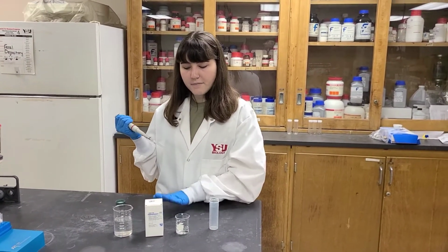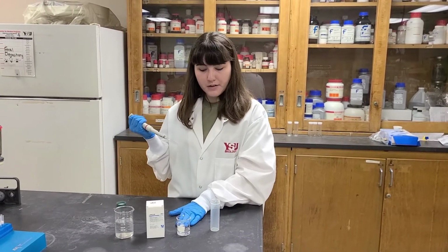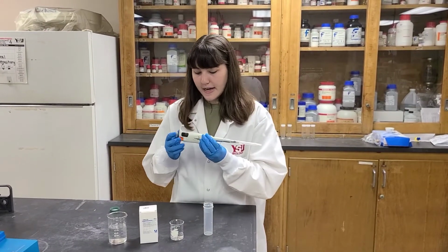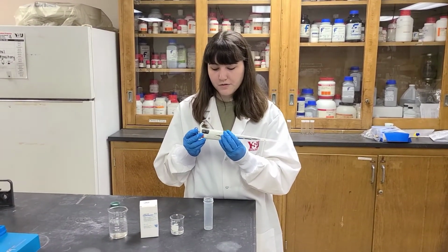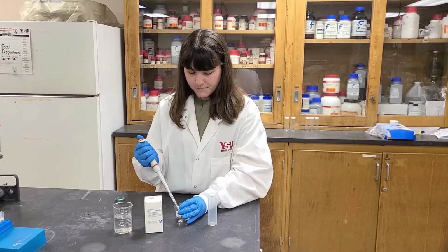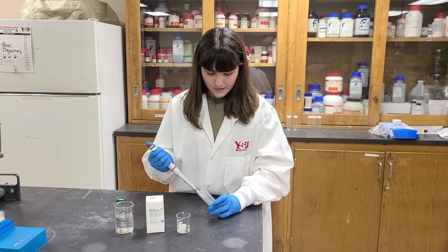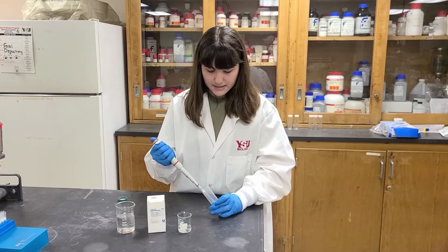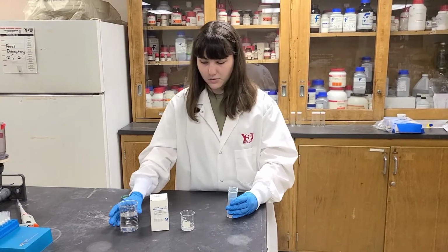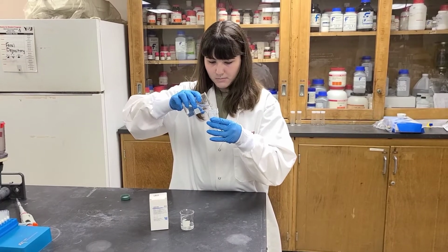Alrighty, so I have my original 100 ppm standard, and I have some of it poured out here in an acid wash beaker. I have my micro pipette set to 0.125 milliliters, and I am going to draw up that amount to the pipette and place that into an ICP tube. And now I'm going to just dilute that standard to 50 ml with milli-Q water.